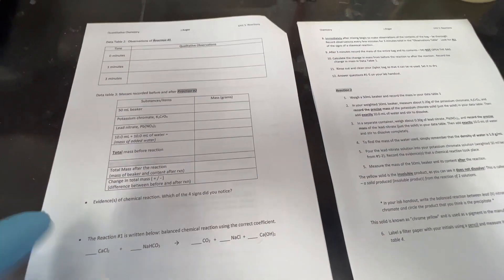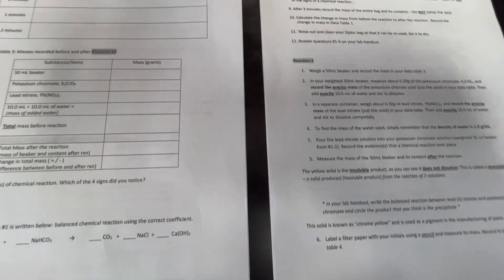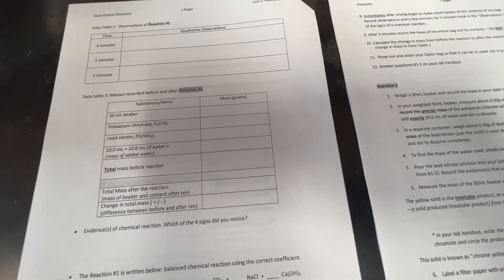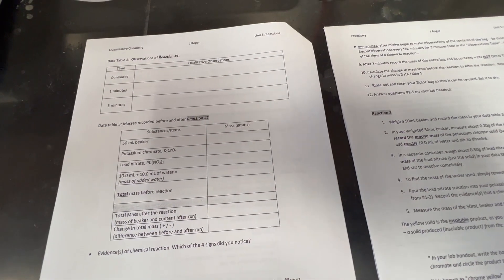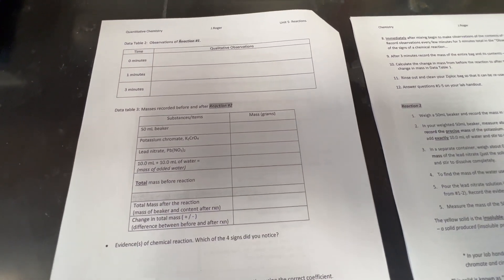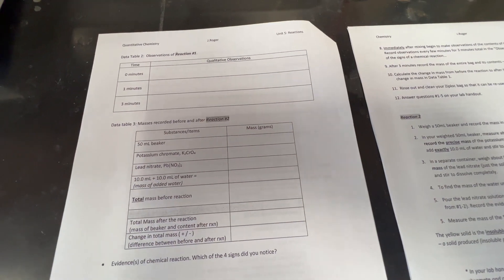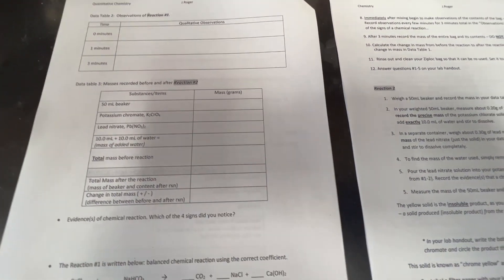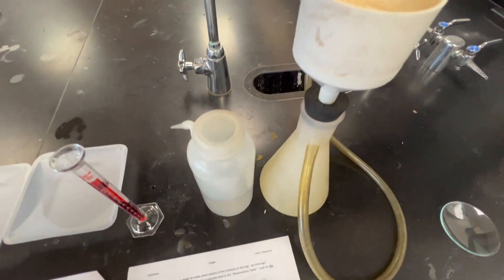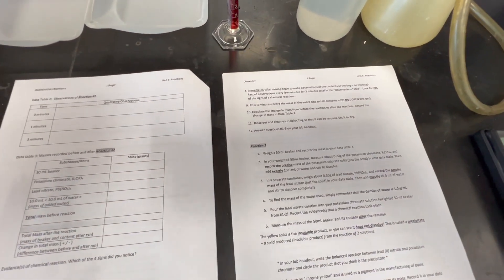In part two of the lab — reaction number two — we're going to make a chrome yellow paint pigment. This is a precipitate. A precipitate is a substance that is a solid forming as a product of a chemical reaction, and it is insoluble. We will prepare two solutions, mix them, a precipitate will be produced, and we will filter the precipitate and recover the dry precipitate on day two.